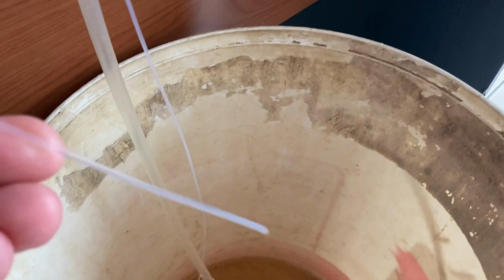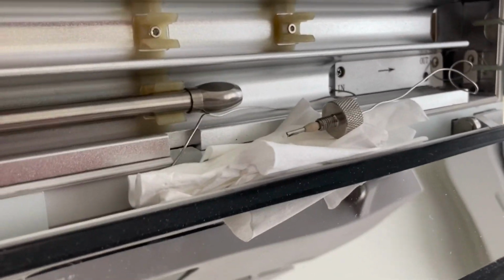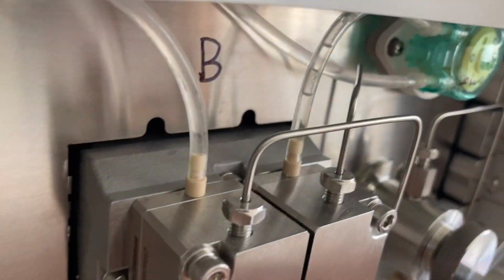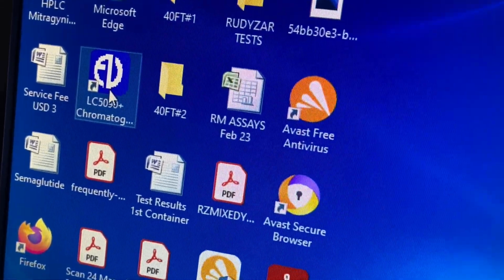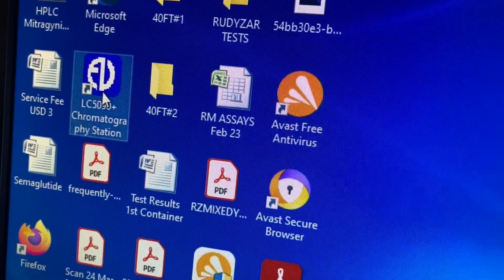Should be dripping here. Yep, that's good. And the column's disconnected because there's plenty of air in the system I can see this time. See the air bubble. Right, then we come over here to the computer. Double click on that one there.